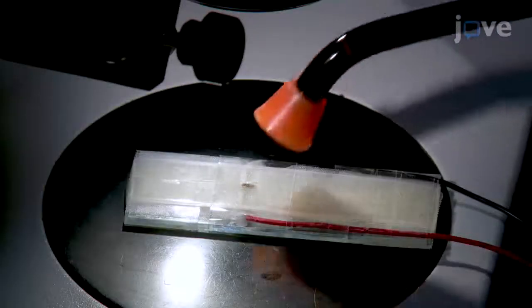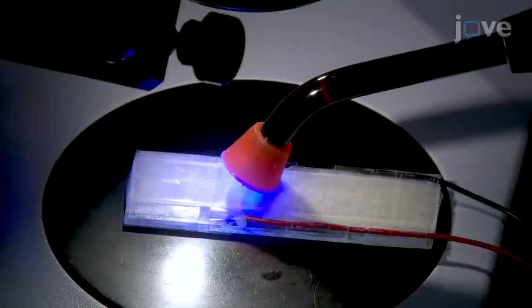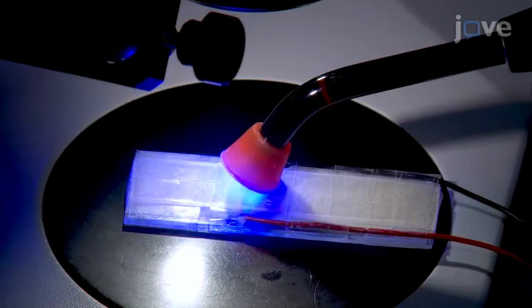Use an insect pin held by concave-convex jaws to carefully surround the sides and back of the head with blue light curing glue, and use a blue light emitting LED lamp to set the glue.